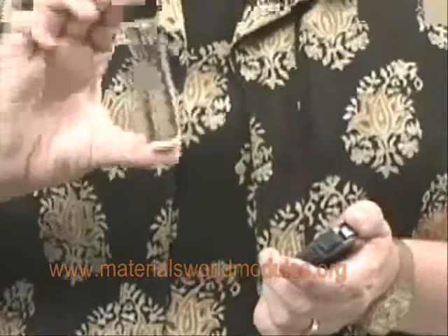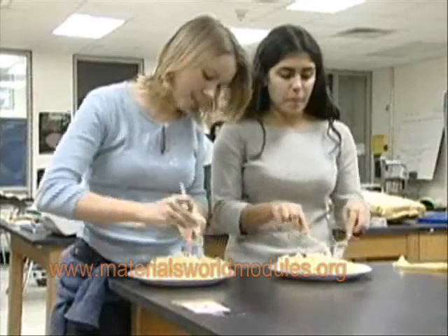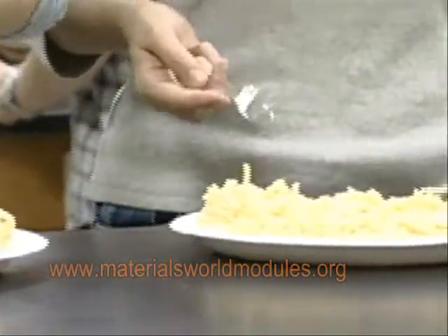In Activity 3, students learn about the property of viscosity, or resistance to flow. In the first part, they're given vials with materials with different molecular weights, and they compare their viscosity by timing how long it takes for a bubble to go from one part of the tube to the other end. They see that the substance with a higher molecular weight takes longer for the bubble to travel, so the higher the molecular weight, the greater the viscosity. This is explained using an analogy of a bowl of spaghetti — the longer the noodles, the more tangled up they get and the more difficult they are to separate, as opposed to shorter noodles. It also gets students to think back to the polymer hunt materials, realizing that most of their polymers were solids, meaning most everyday polymers are very long molecules with very high viscosities that exist in a solid state.